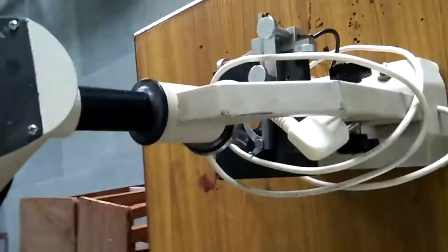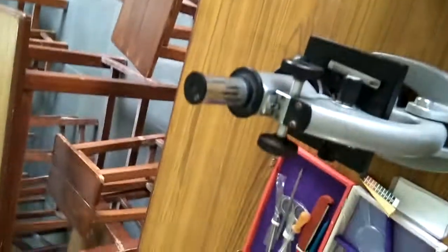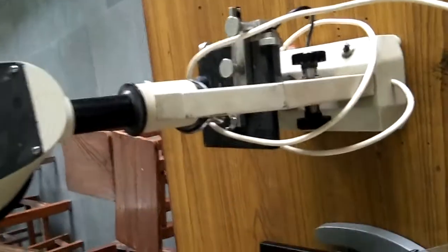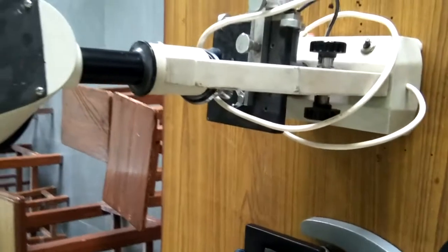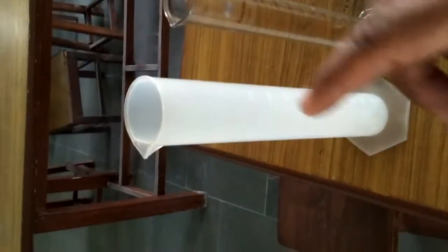Now let's see, this is a light microscope, which is used for observing various types of micro specimens, and it functions with light. So students, these are the different types of microscopes in your biology lab, which are very essential in your biology practical. Again I will repeat the names of the different biology apparatus step by step.